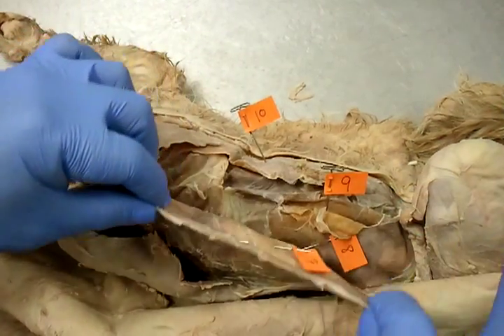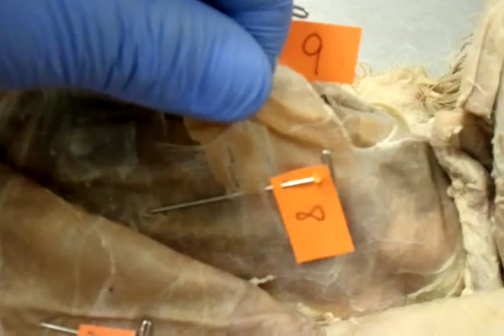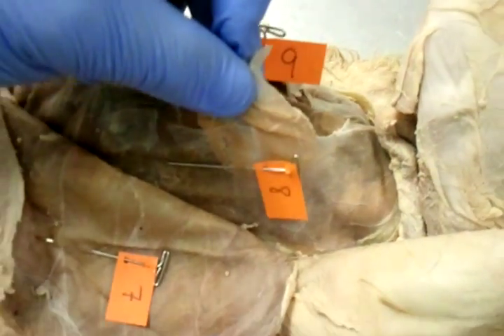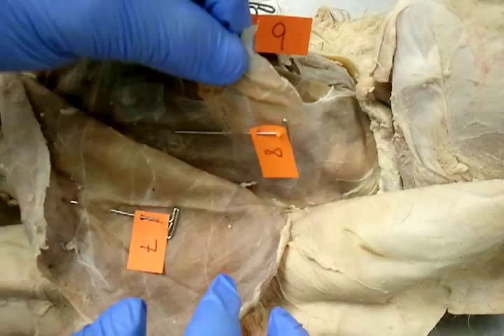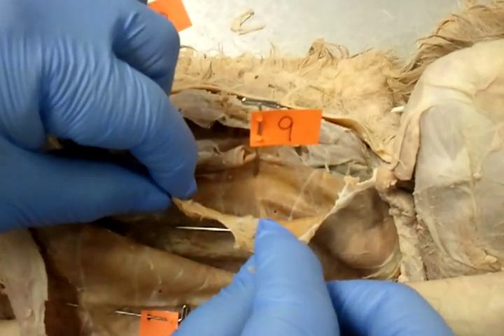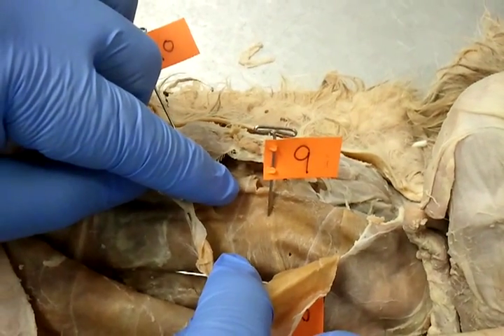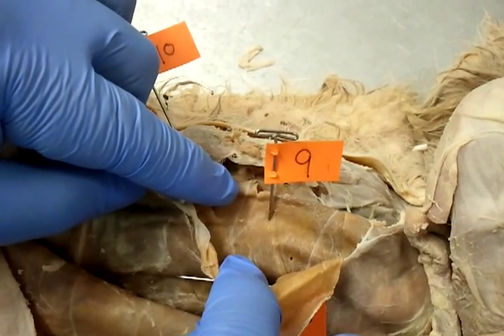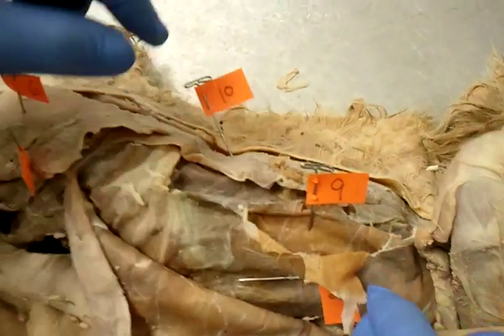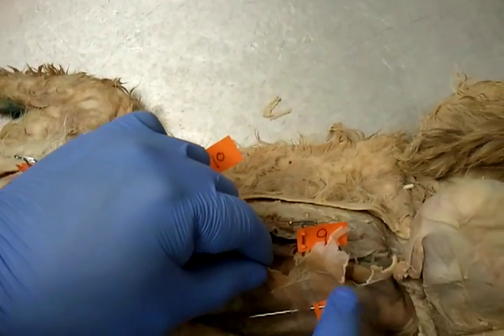Moving on, number eight is the thin layer called internal oblique. This thin layer right here is internal oblique. The layer underneath internal oblique, number nine, is called transverse abdominus.